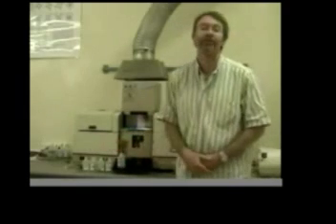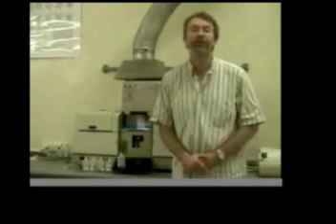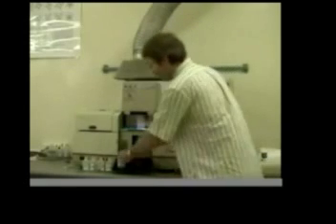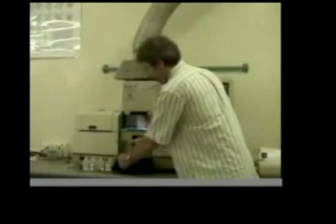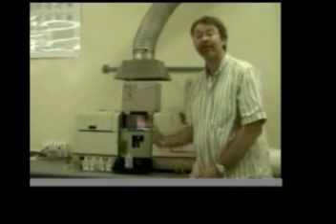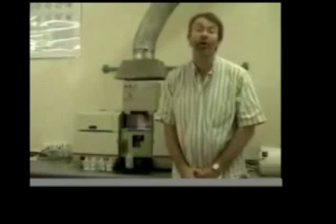What I have lined up in front of the instrument are a series of solutions with known different concentrations of copper. And if I take one of these solutions and introduce it into the flame, you can see a change in colour. This change in colour is indicative of the concentration of copper in solution.